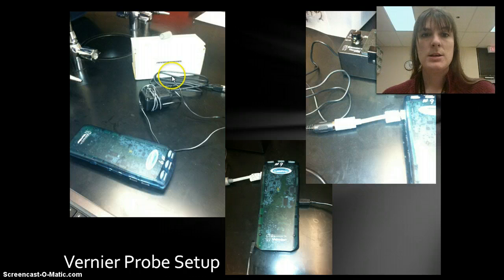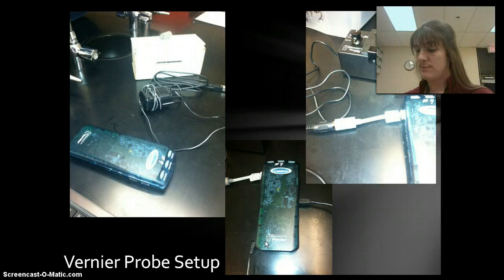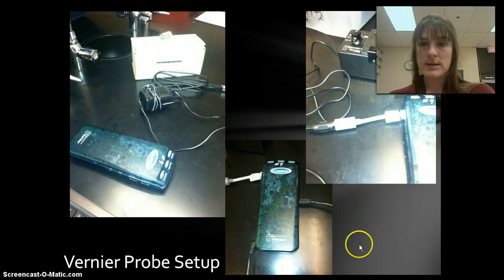So the first thing you want to do is set up everything going through this little box. First you need to plug it in to the wall. These things need power. When you plug it in, you're going to hear a little beeping sound like that one, that will tell you that this thing is attached and has power. The next thing you want to do is plug into the computer. There'll be a USB that goes from here directly to the USB drive in the computer.